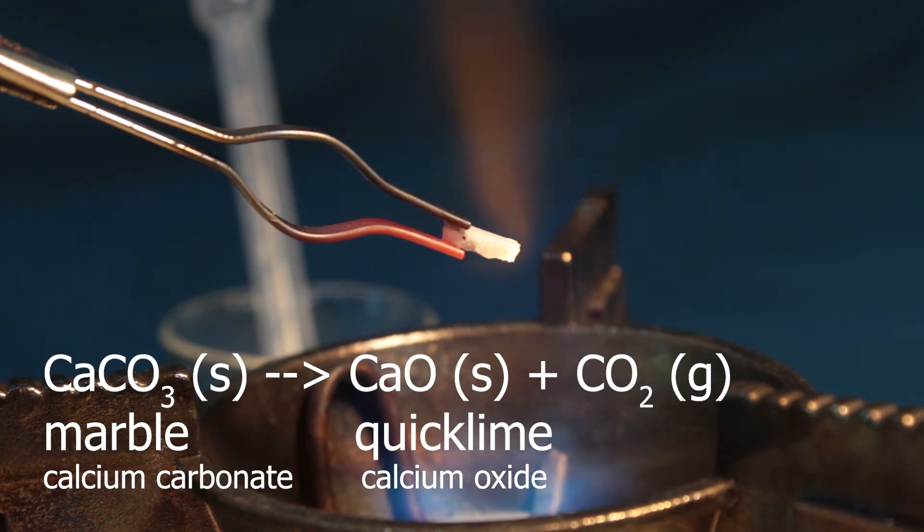Now, for heating it up. You see, I need pretty high temperature for thermal decomposition, above 650 for sure.